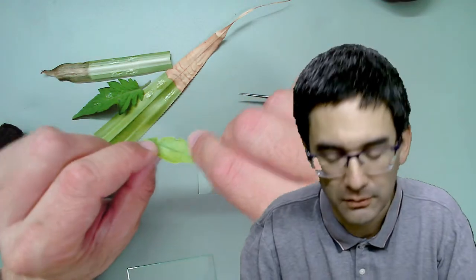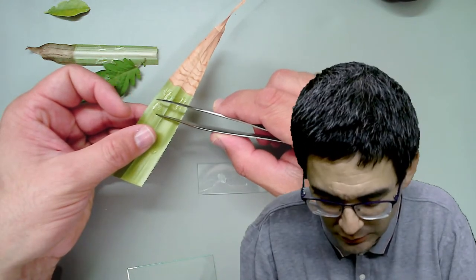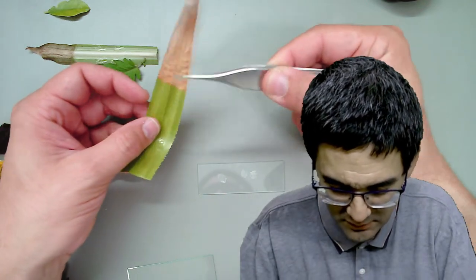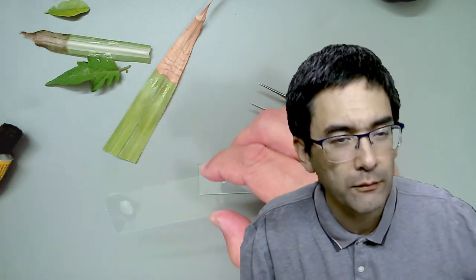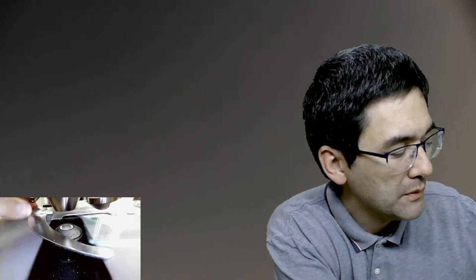Let's try this other plant - I don't know the name of it, but I chose it because it also has a smooth bottom side. I think I've already mentioned you can try different types of glue - white wood glue also worked. This one was actually drying a little bit faster.